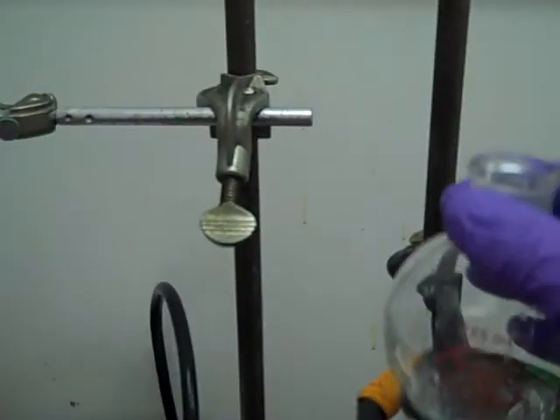So now we've got two immiscible layers inside this separatory funnel. You can see clearly a line between those two layers in the separatory funnel. So which is on top, which is on bottom, you've got to know the densities of your two liquids. In our case, dichloromethane is denser than water, so it's down at the bottom. And then the water sits up on top.